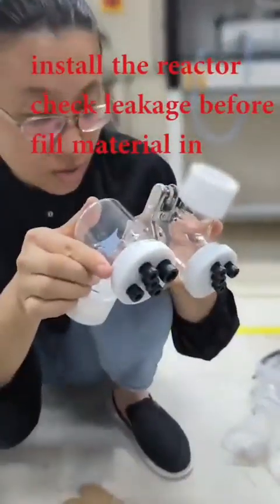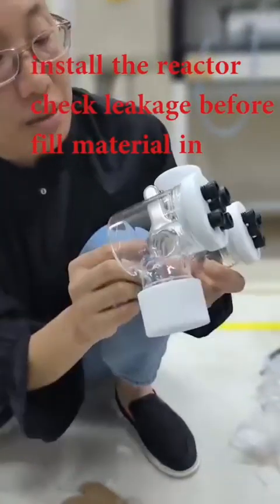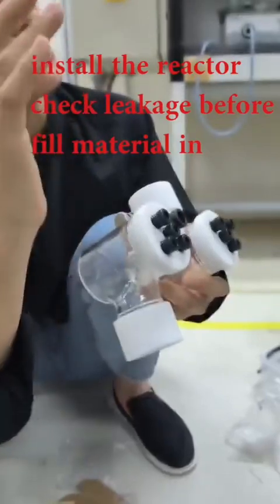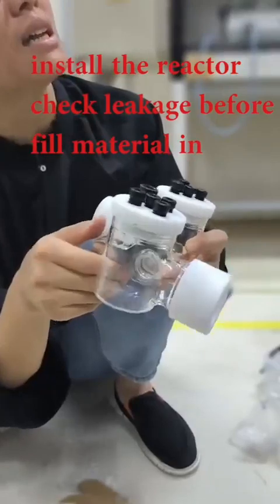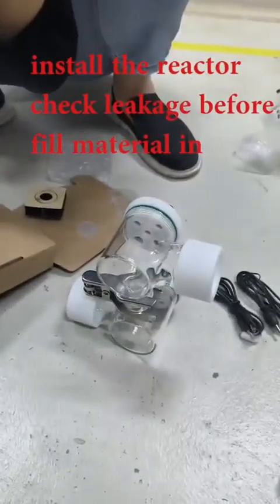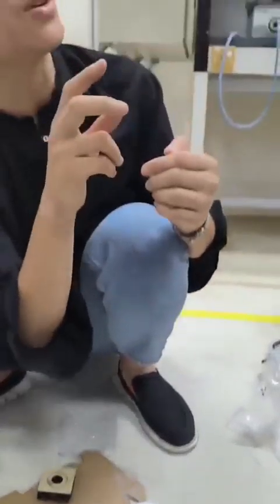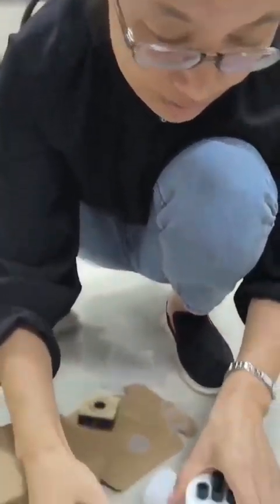Now you can fill in water to see whether you sealed it properly. If it is not sealed properly, and maybe at the beginning when you do not have good experience, the membrane slides here and there, just practice several times. Once you have your own experience, like how to angle it, lay it down, or have another person hold it for you, whatever works, the final target is no leakage. So this is all done for the reaction.